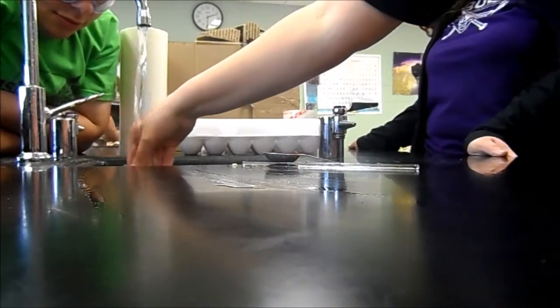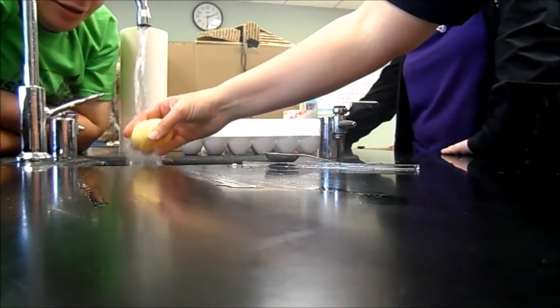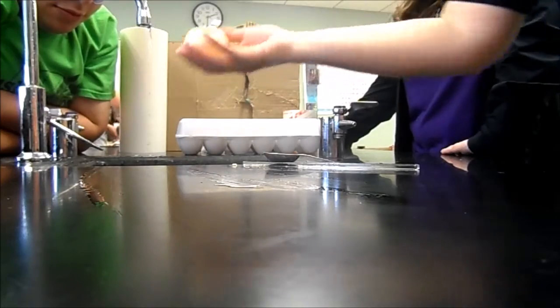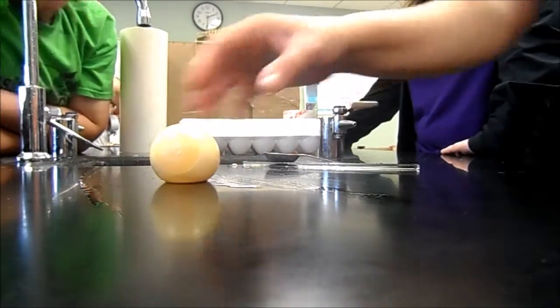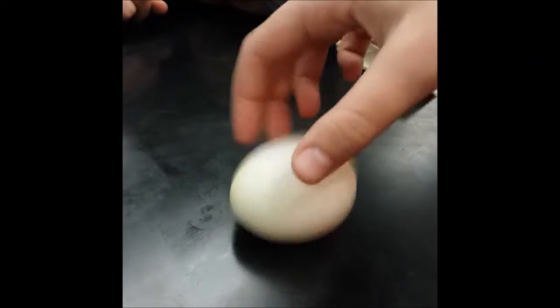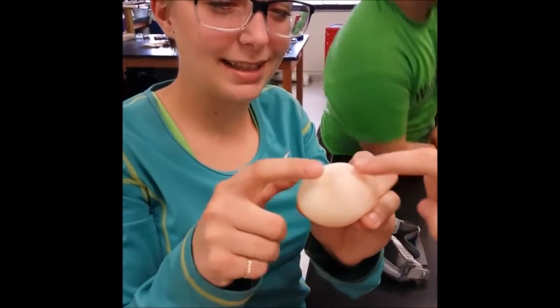The yellow part kind of affects it like scrambled eggs. Ooh, that one turned out way different, way more yellow. I wonder if that's any rotten egg. So there's one. Dead, dead, dead. I like the chicken ready version.